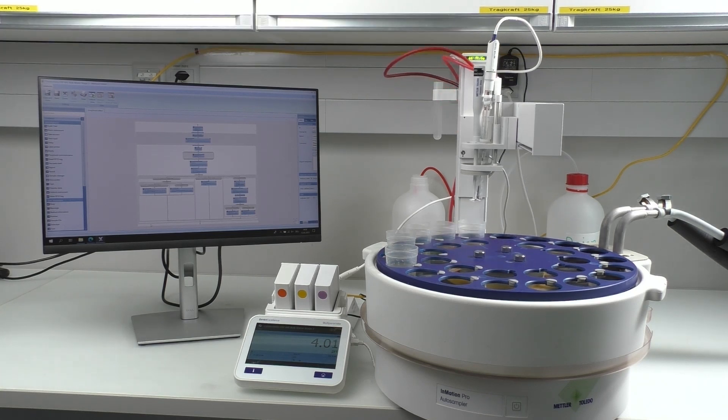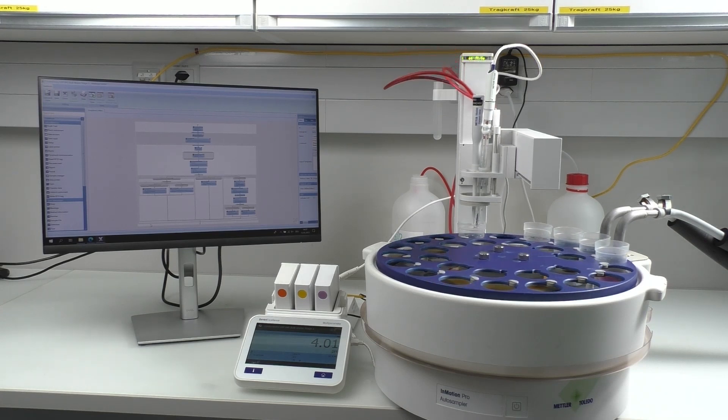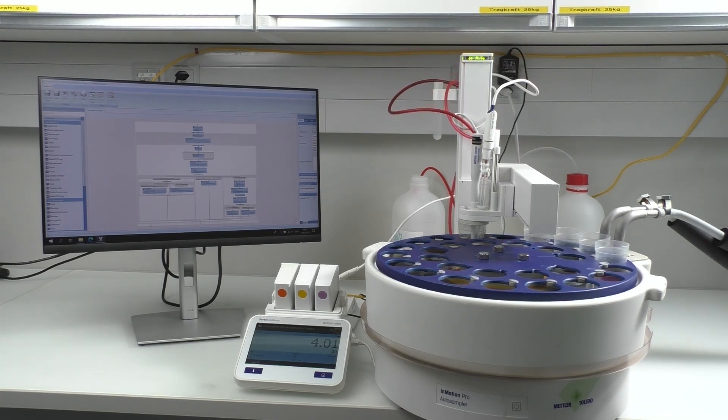Between each buffer, in motion and power shower perform rinsing and draining. Once the calibration is done, LAB-X checks the condition of our pH electrode.